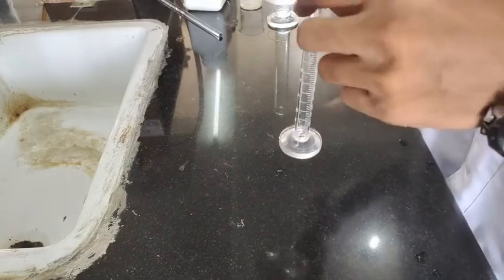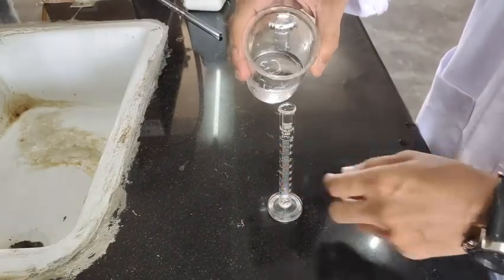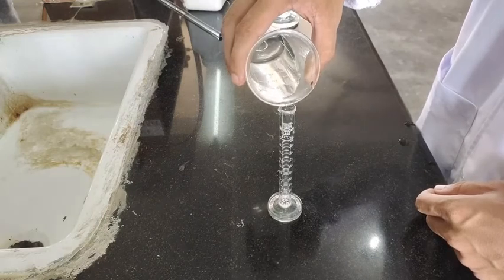Next, measure 10 ml of this solution from the beaker with the help of a 10 ml measuring cylinder.